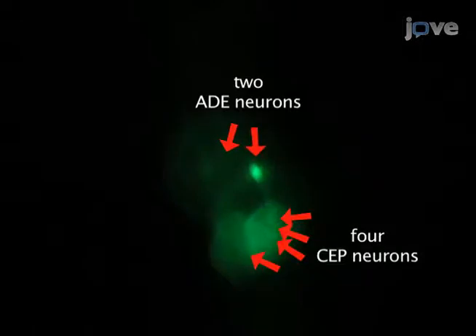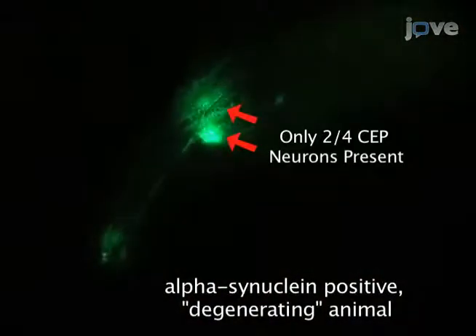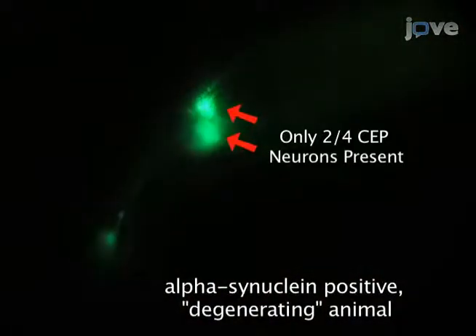Generally, the worms expressing only GFP in the dopamine neurons do not exhibit cell death. However, in presence of alpha-synuclein, you will observe dose and age-dependent neurodegeneration. Using this assay, a transgene could be co-expressed in the dopamine neurons to determine whether it can enhance or suppress alpha-synuclein-induced toxicity. So let's get started.